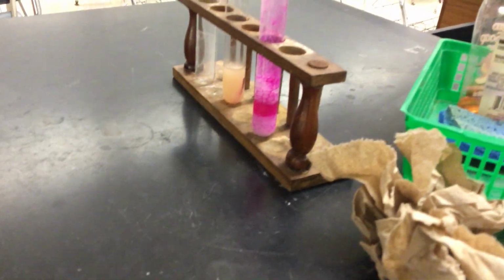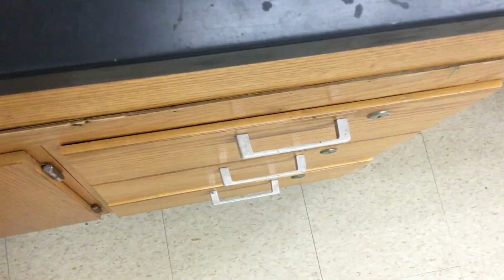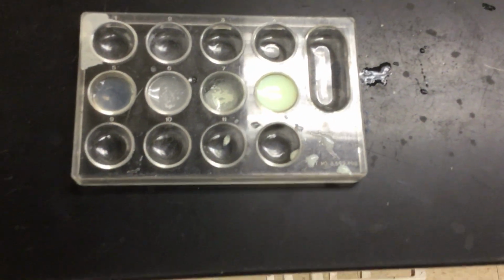Okay, you're now going to use this information from part 1 and 2, the tubes there, and parts 3 and 4. Keep getting my finger in the way. You're going to use that information to answer the questions on page 28.